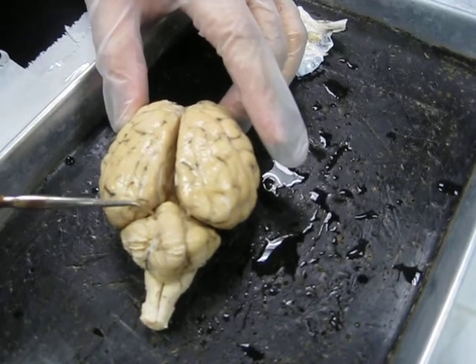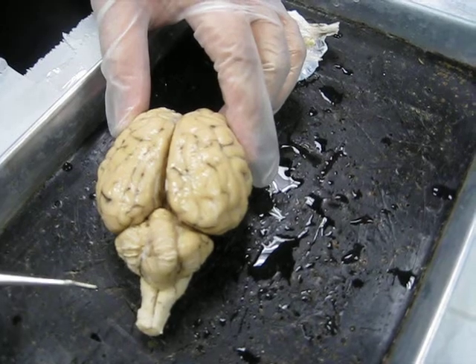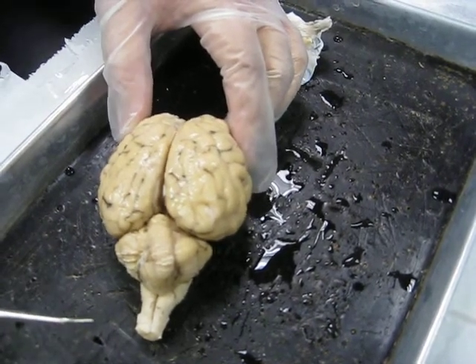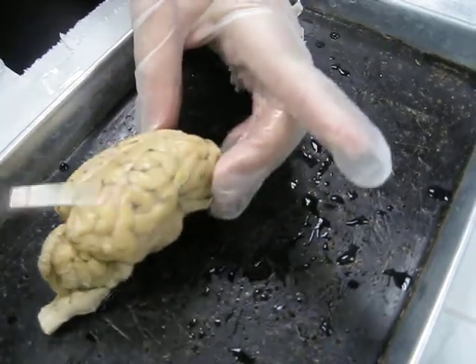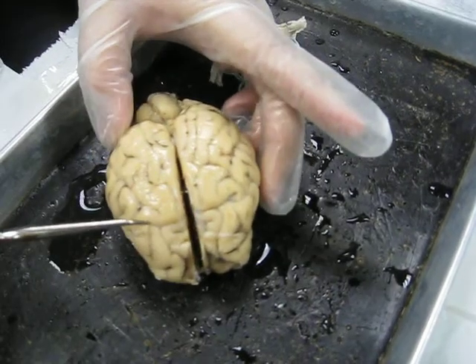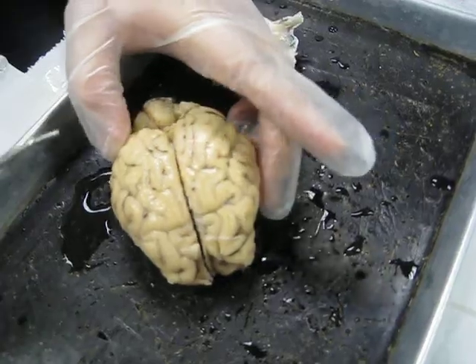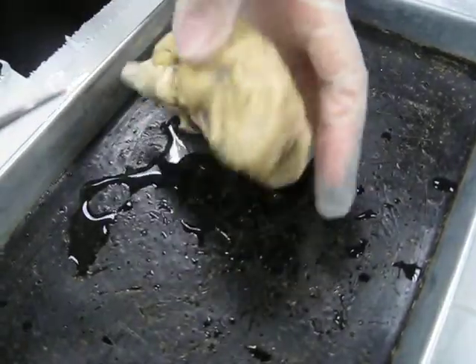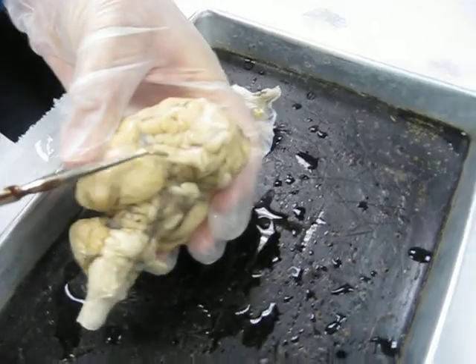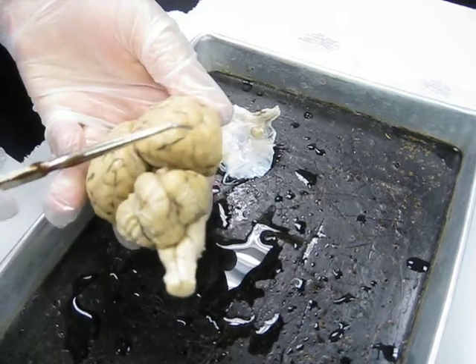The cerebrum is divided up into lobes, the same way that you divide up the bones of the skull, and they're named in the same fashion. So we have a frontal lobe on each side. Frontal. Parietal lobe, sides of the cerebrum. Parietal. The temporal lobe is kind of stuck a little bit down underneath here. Temporal. And the occipital lobe, which is the back portion of the cerebrum, back there beneath the occipital bone.